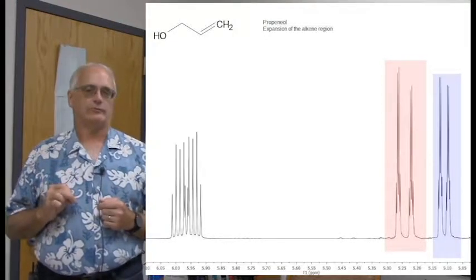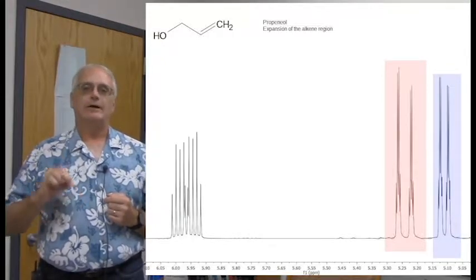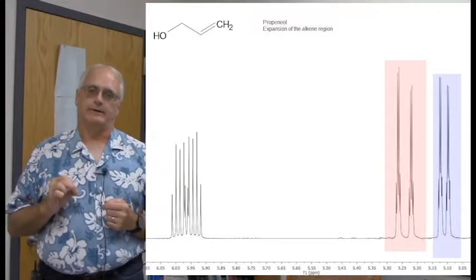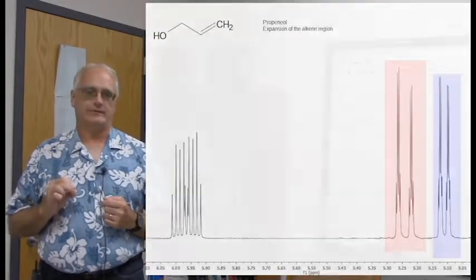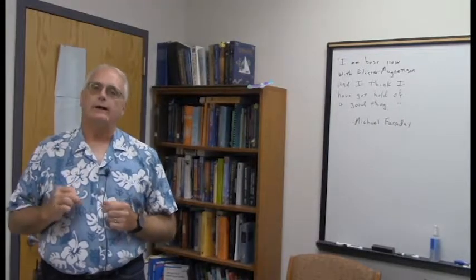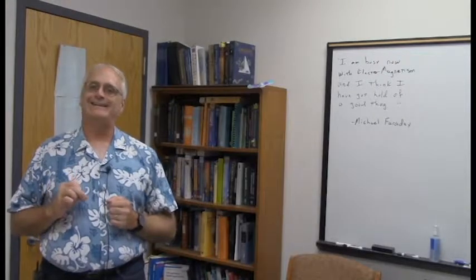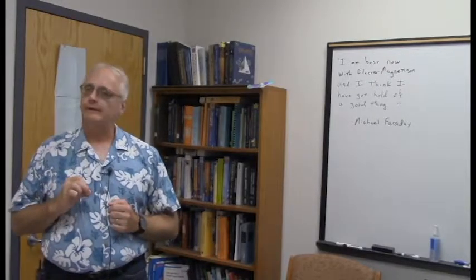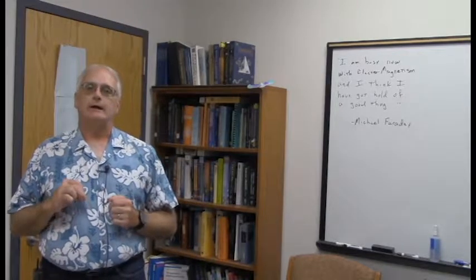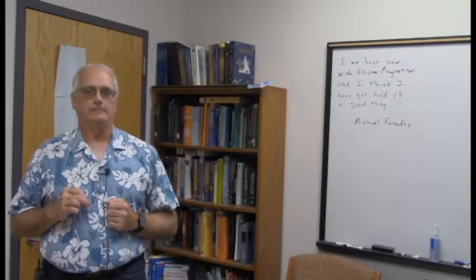And I want to emphasize one thing here. If you look, it should be pretty obvious from this proton spectrum. Even though these are two protons on the same carbon, these are two very different signals. And it's sometimes instructive to analyze, why are these two protons of this methylene group, the terminal alkene methylene group, why are they different? Whereas in the other methylene group, the one next to the oxygen of the alcohol, why are they equivalent to each other?